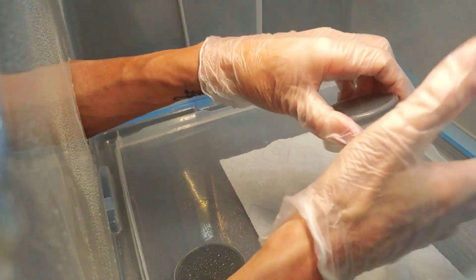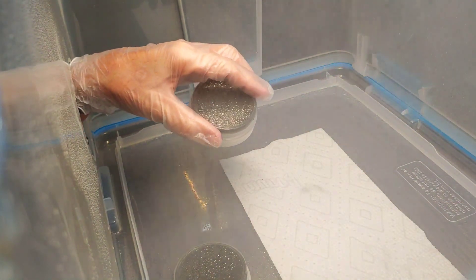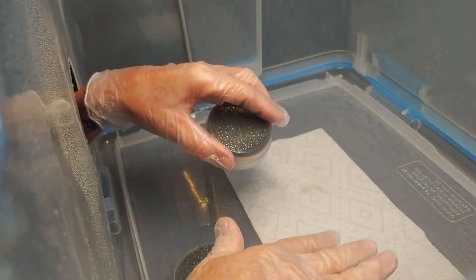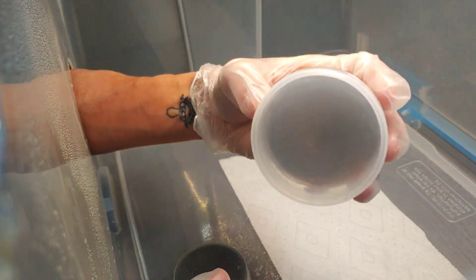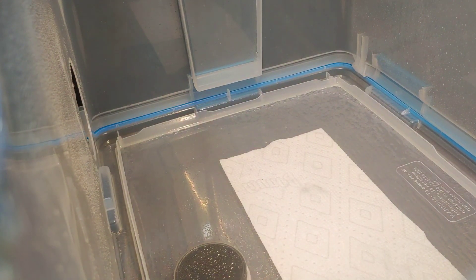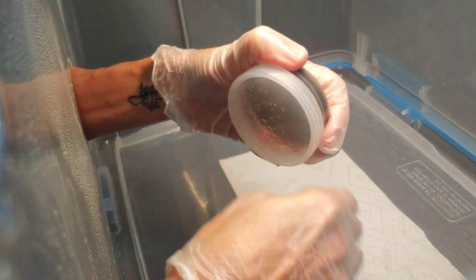Close it back up — always keep them facing down, because we know that spores and stuff fall from the top down, just like this alcohol cloud goes downward. That's how everything goes. Look at it now — it's really clear. In the next day or two or three days it's going to clear up even more.